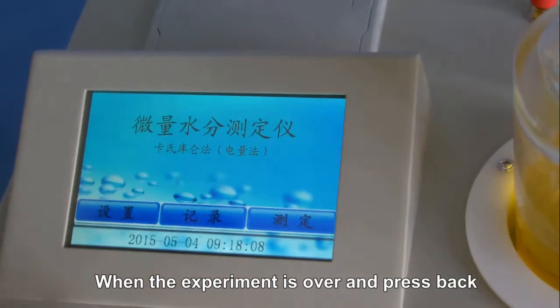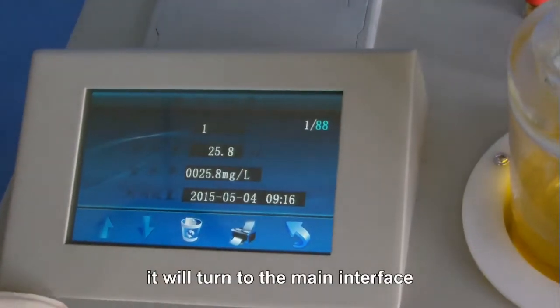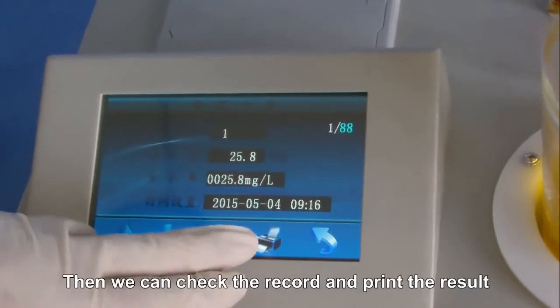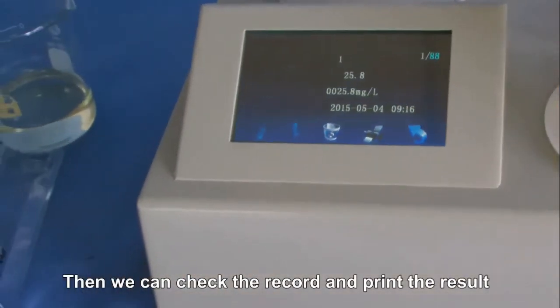When the experiment is over, press back and it will turn to the main interface. Then we can check the record and print the result.